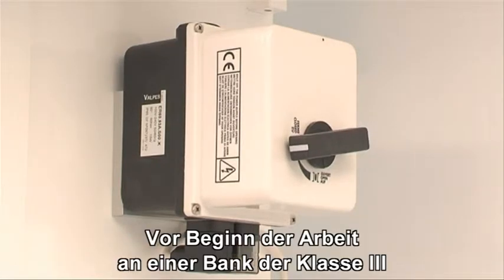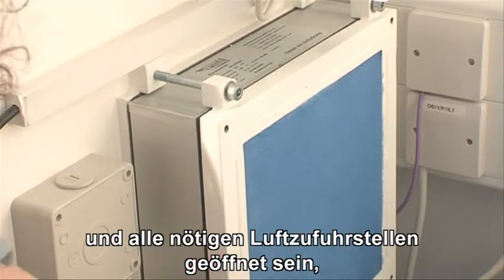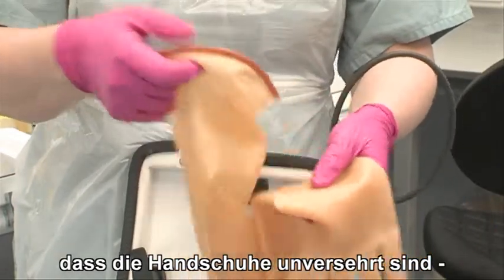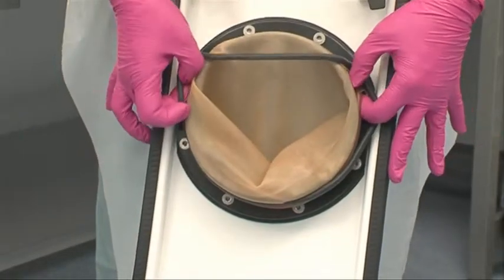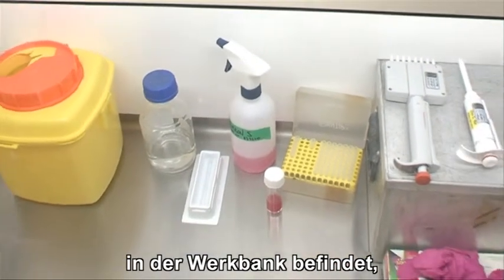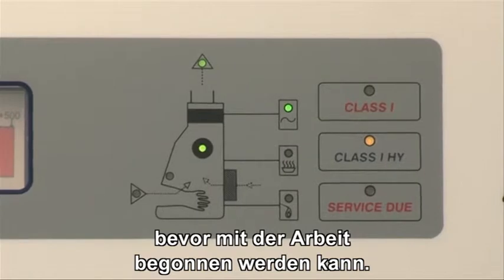Before working at a Class 3 cabinet, make sure all dampers are in the correct positions and that all necessary air intakes are open. Check the pass hatch is fully operational and closed. Check that the integrity of the gloves has not been compromised, especially around the seals and at the wrist cuffs. Make sure there is a bottle of the appropriate decontamination solution placed inside the cabinet along with all the equipment you're going to need. Make sure the pressure dials are in the safe working zone before you start any infectious work.